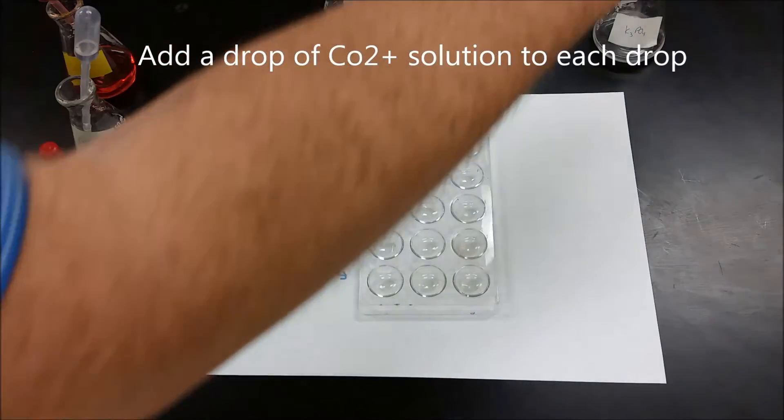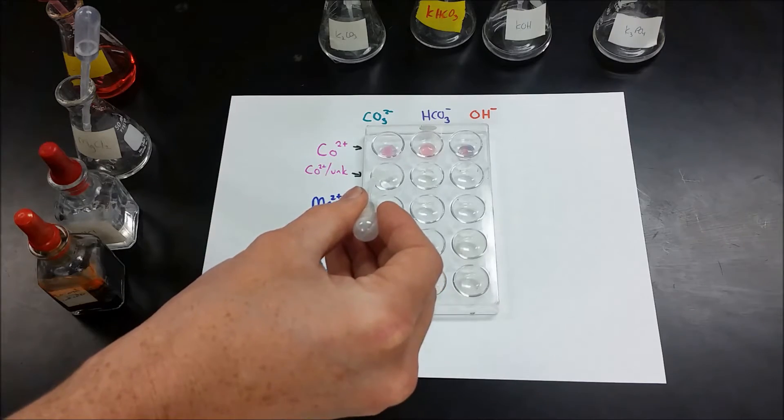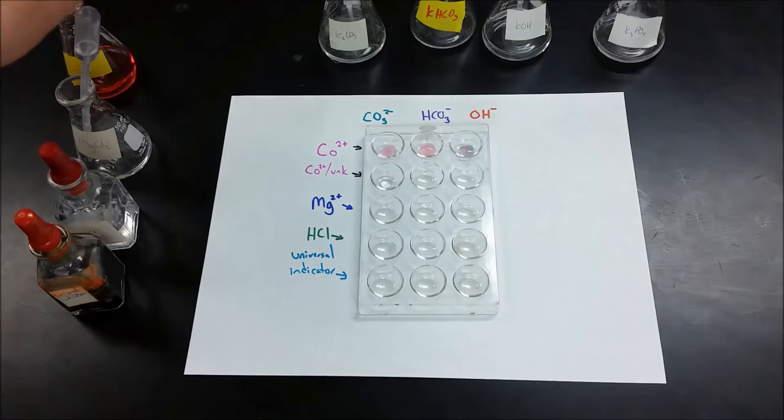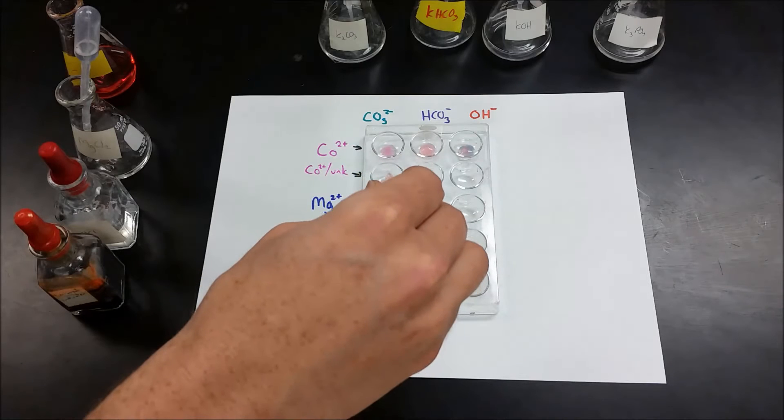And then for comparison, we're going to do an unknown that is not any of the three. So I've chosen a phosphate, which will give you similar results, but definitely different.